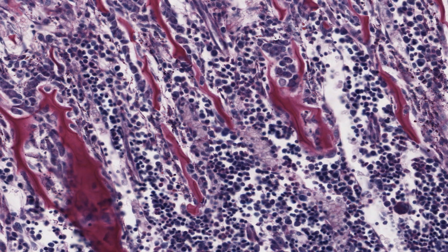The surviving spicules of calcified cartilage protrude into the marrow cavity as the zone of ossification. They form a firm substrate for osteoblasts to attach to. These cells are lined up on the thin, almost black calcified matrix. The nucleus is pushed to the side, and the large pale-stained area of cytoplasm you can sometimes see is the very active Golgi apparatus.